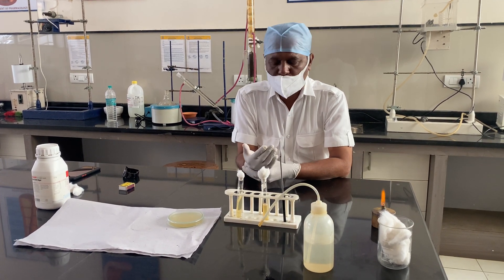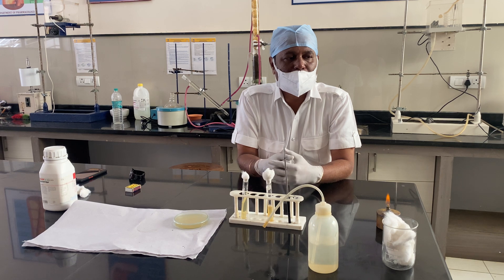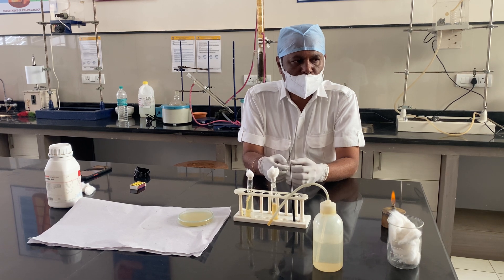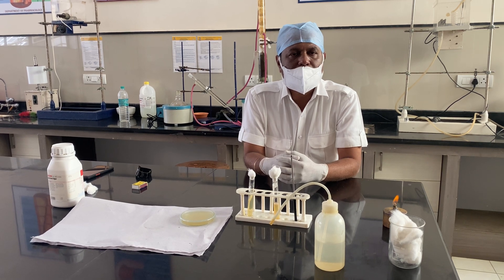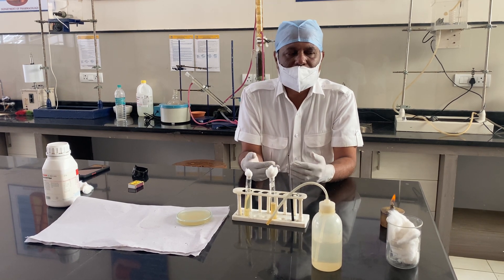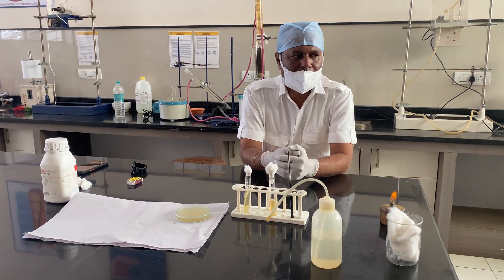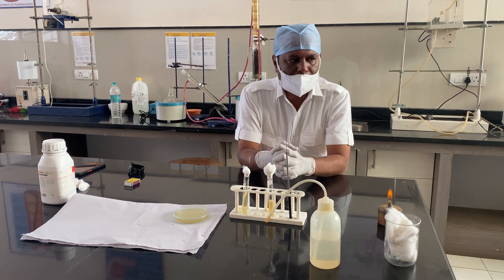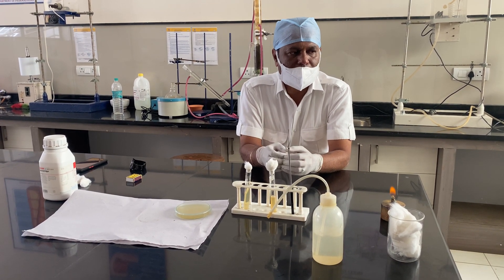When microorganisms need to be subcultured from an old culture, they are inoculated into fresh nutrient media. These incubated microorganisms will give you information about their growth. Such cultures can be preserved temporarily by keeping them in refrigeration at four degrees centigrade.